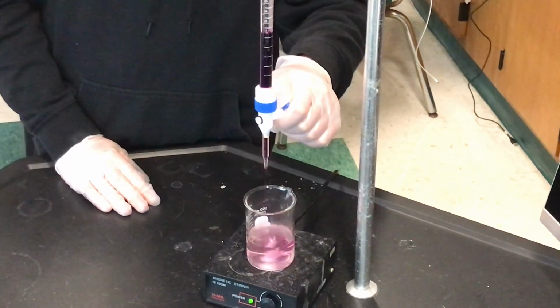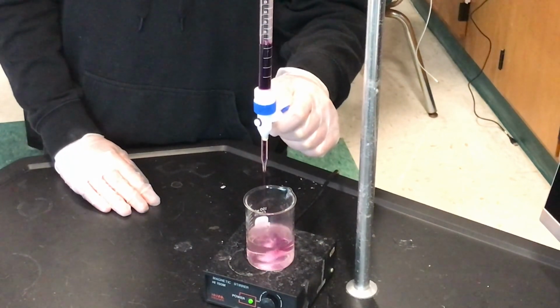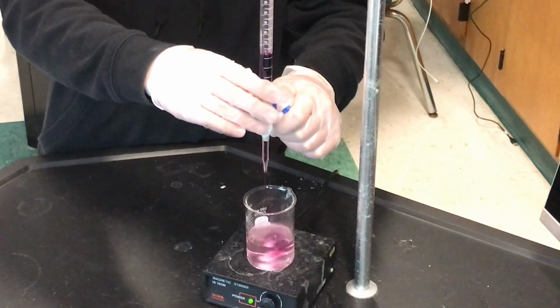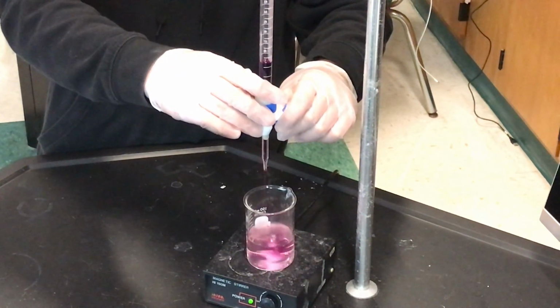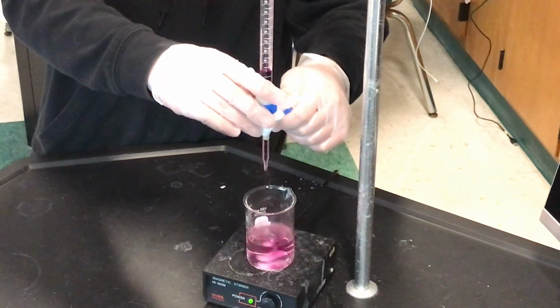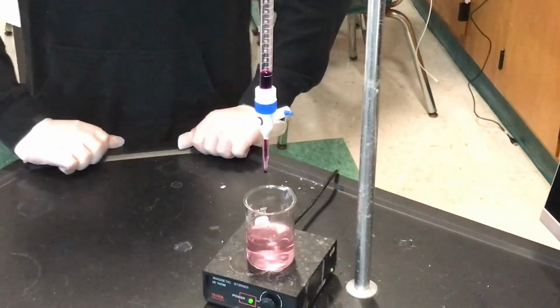We're getting close to the end of the burette too. Okay, so like I said, I calculated that 1 burette full of 50 would be enough for both. We'll see if my math makes any sense. Looks like it's persisting. Did we stay purple? I think you're staying. Stop. Let's see her persist for 30 seconds.